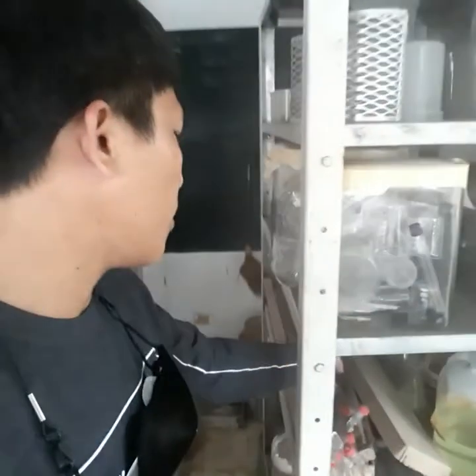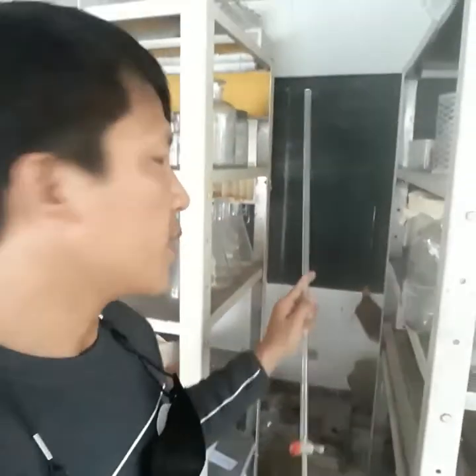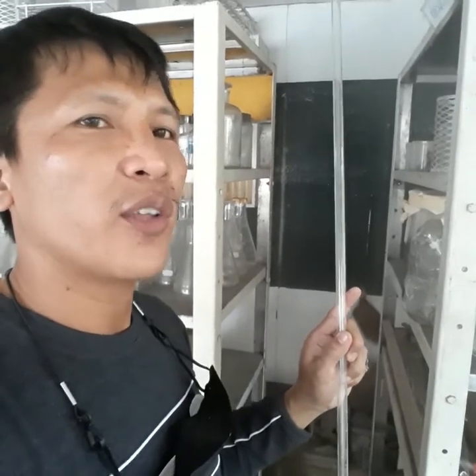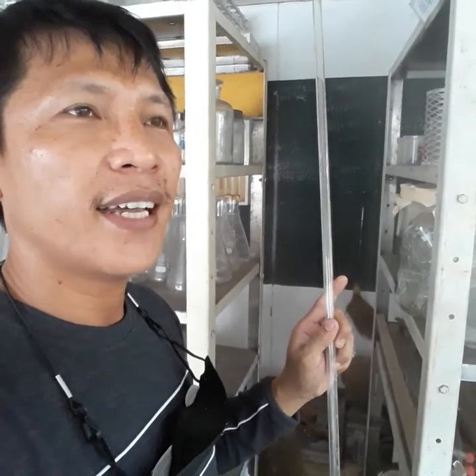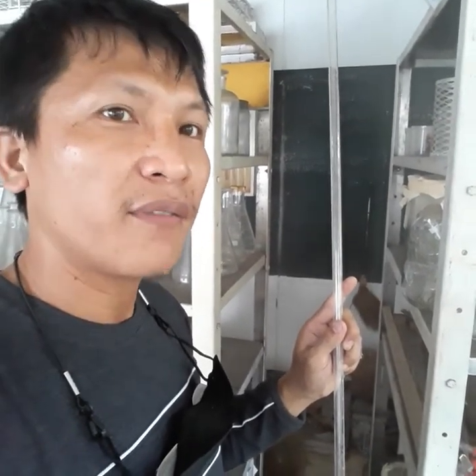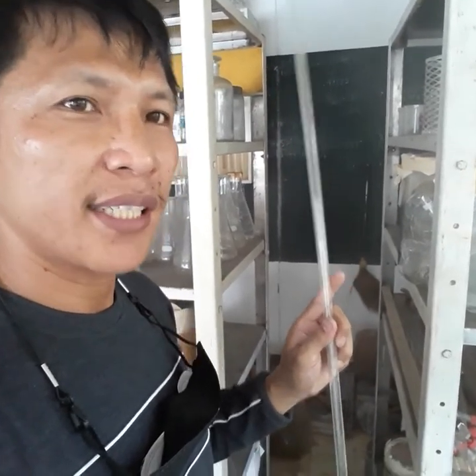But again, these are burets. We also have student type burets, which can be mounted, especially when you're in the field. We call these student burets. There are acid and base burets for this one. This one is also a buret, but again, this is somewhat handy. You can just bring it wherever you go, especially during field analysis or field sampling. You can just buy this type of buret. Okay.